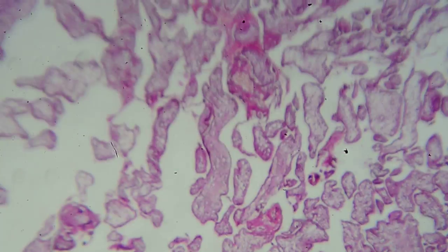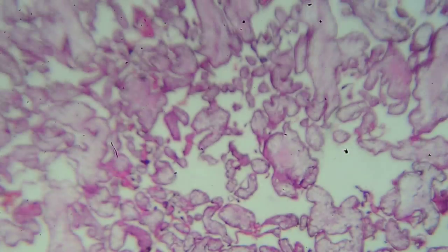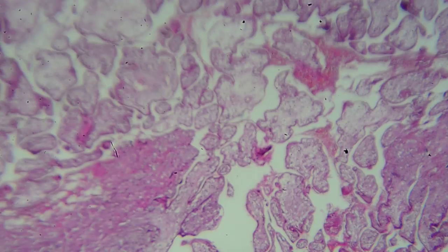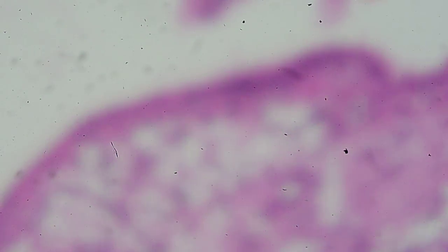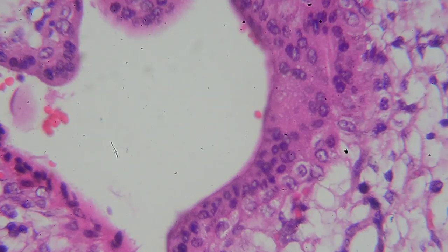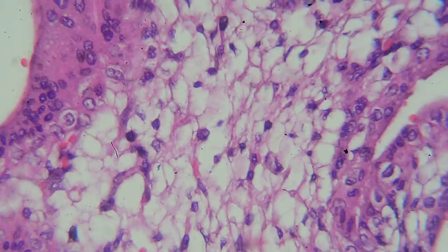These are chorionic villi — products of conception, placental tissue. Under the microscope you see clear villi lined by cytotrophoblasts — the thin ones lining the edge — and then the multi-nucleated ones are called syncytiotrophoblasts. Inside the villi it's kind of clear with some cells in there. That's all you really need to recognize.